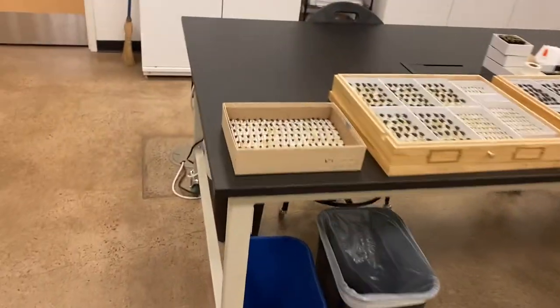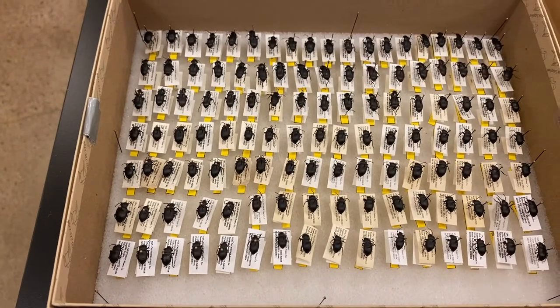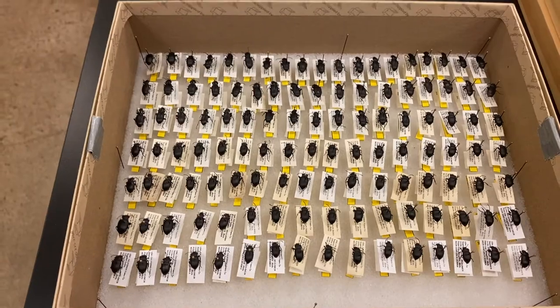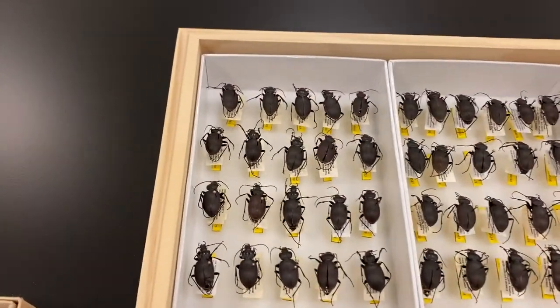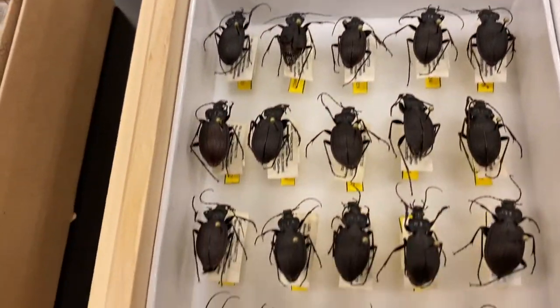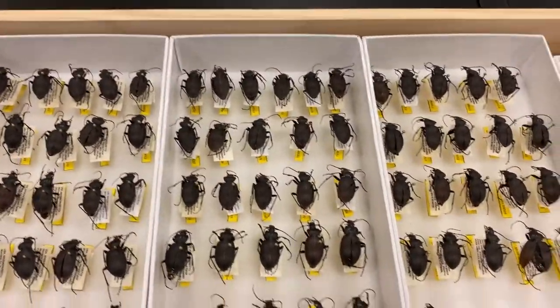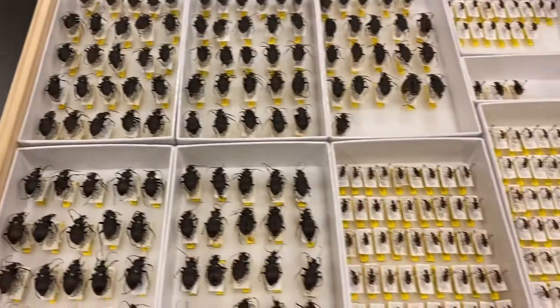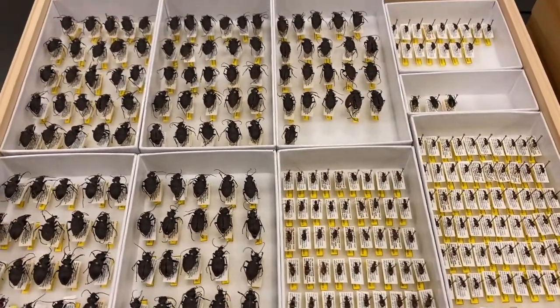For the pinned insects, here's a box of pinned beetles that was shipped to us from a domain. Each of these we will separate out by species from that domain as we check them in. Each one is checked in based off of the catalog number and the sample ID on the yellow label underneath, and they're separated into an individual unit tray within this drawer. You can see that each unit tray has a single species in it. That's the check-in process.